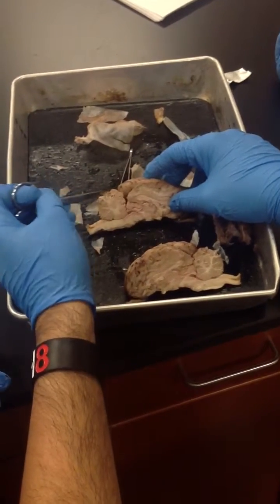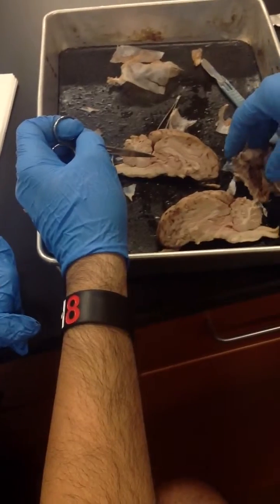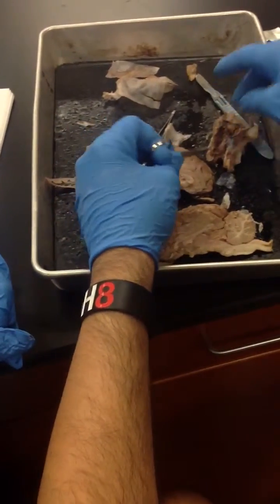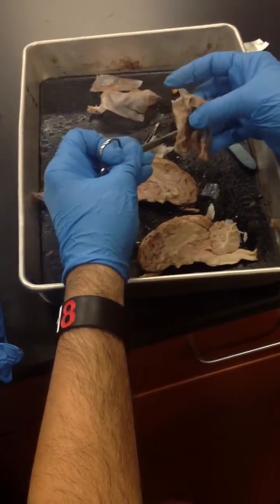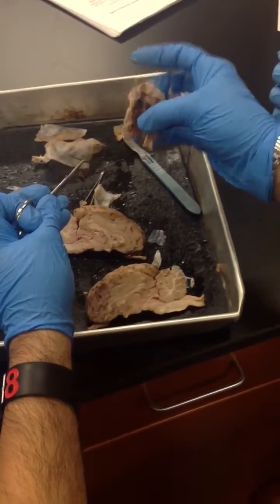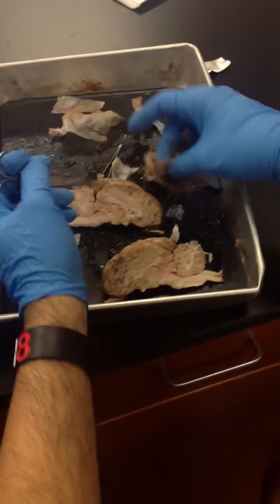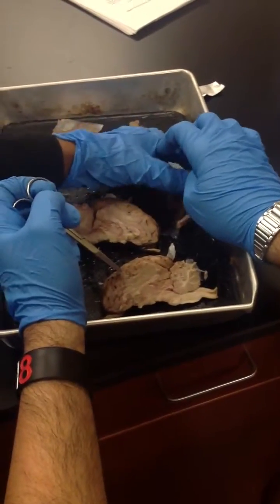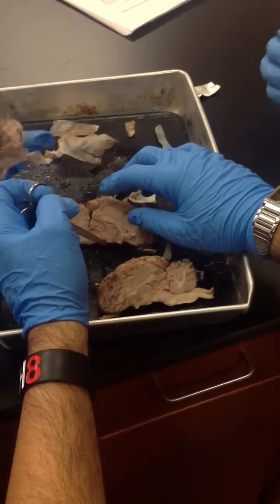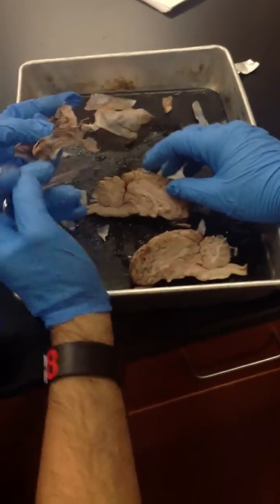And so where's the gland that he was talking about? That was pituitary gland. You cut it off earlier. Okay. So it's technically this little dense thing right there. So if you feel it, and I know you don't want to feel it, but it's like a dense little circle ball right there. It hangs underneath the brain. So when you cut it off, it's right there. Feel that dense ball? That's the pituitary gland.